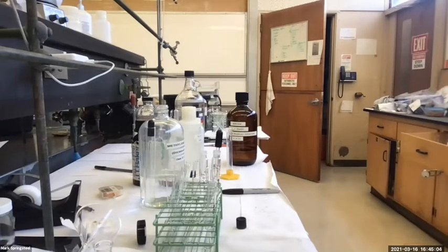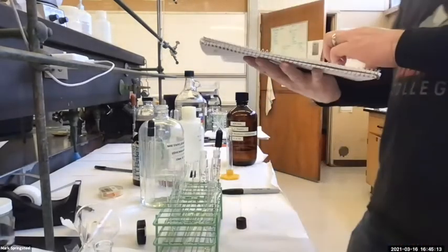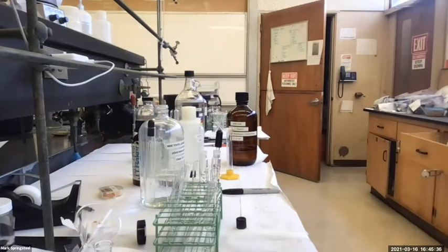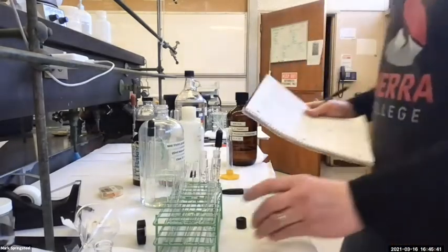And I got a reading of 30.1310. Let me get a pen. Okay, I got 30.1312 grams actually when I went back.